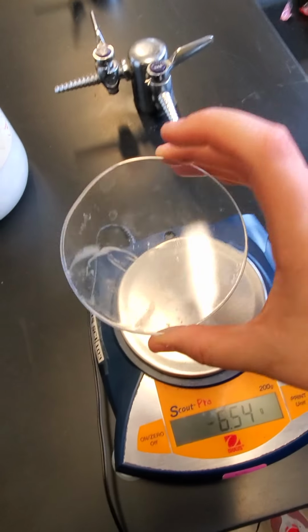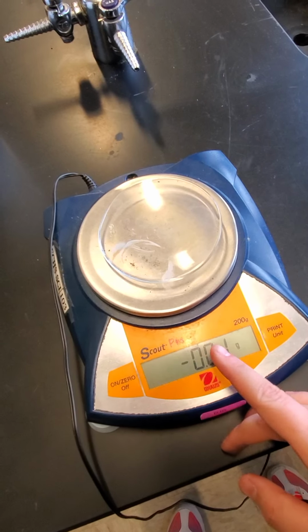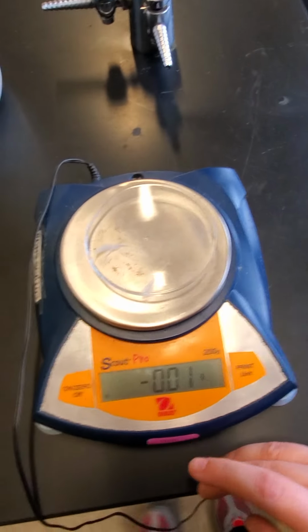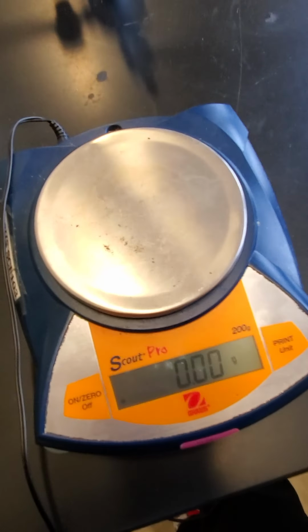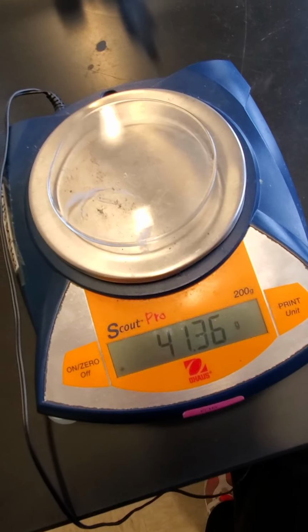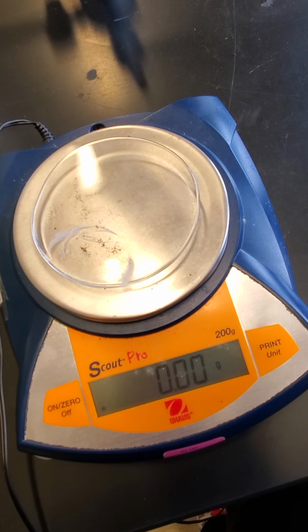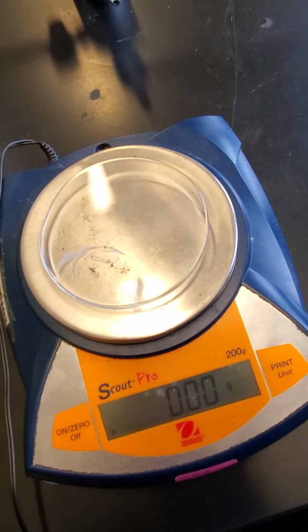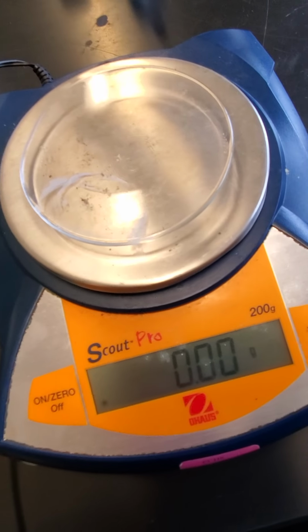So let's take it back over here to our scale. I have this Petri dish that I'm going to put our solute on. I'll place it on here. I already zeroed out the scale one time, but just so you know, let me zero it out. When you turn the scale on, it'll show up as 0.00 grams. Anytime you put anything on it, it's going to change, obviously. So that Petri dish is about 42 grams. But I don't want to do the extra math, so I'm going to go ahead and zero that Petri dish. And so that means that that is what we're starting with. So any amount of solute that I add on top of it, it'll show me that exact amount here.